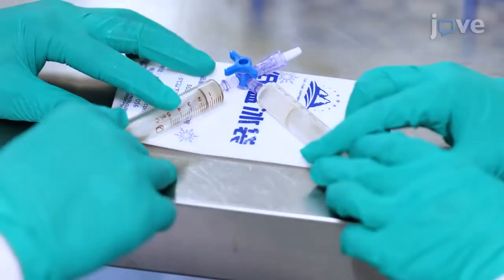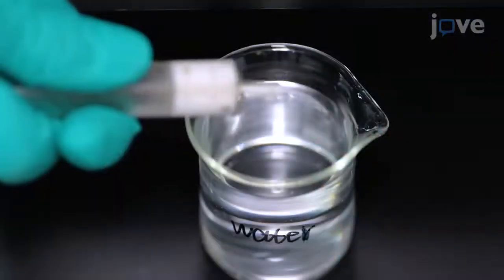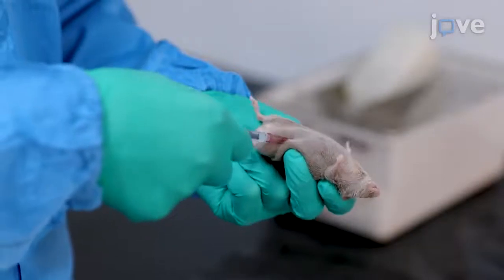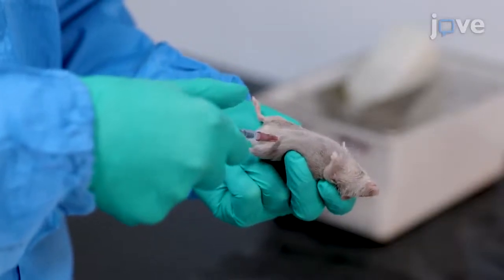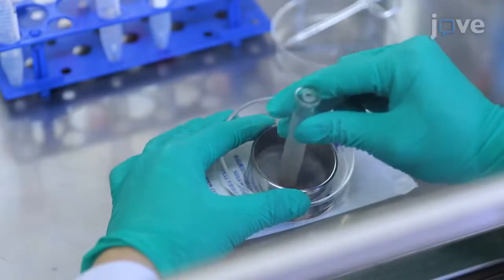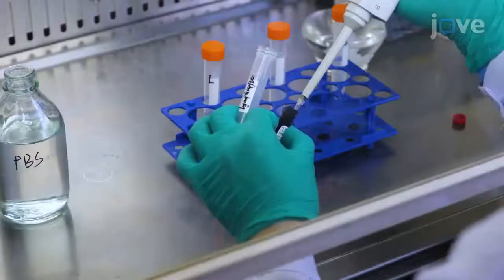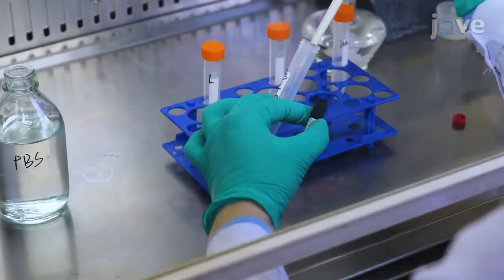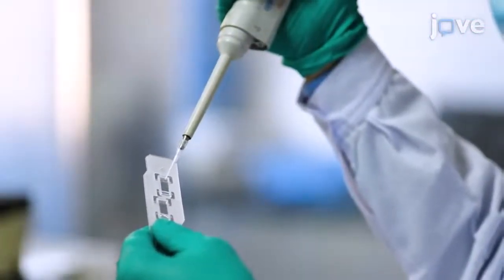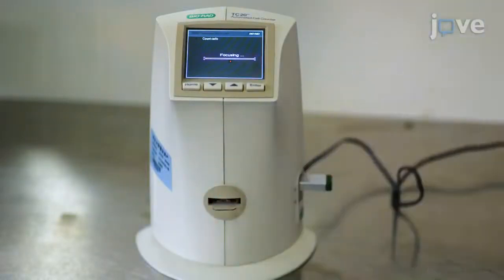Then we use iNKT cells with immunomodulatory effect for their treatment. iNKT cells have a good effect after treatment by in vivo introduction, which provides basic data support for the clinical application of iNKT cells, and fully exploits the clinical application value of iNKT cells. The greatest advantage of this technology is that it is simple to operate and easy to copy.